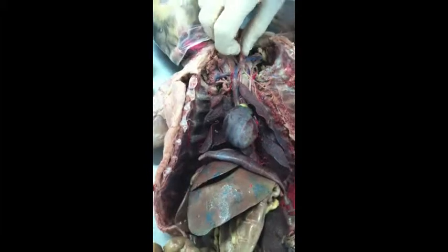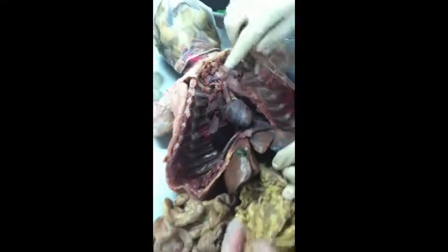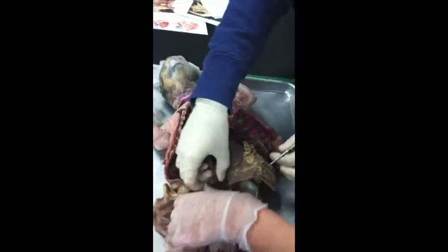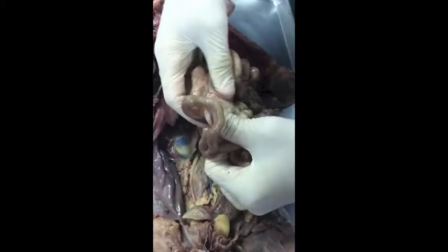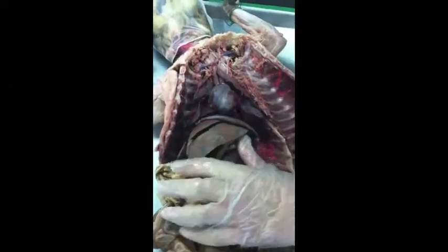So you wanted lymph nodes? I would like to ask, it's usually in the neck. I don't see any there. Oh, there were some in the mesentery. Yeah, little beans, right there. You had some lymph nodes in there. Did you get that lymph node? Here you go. Right. And then the spleen.